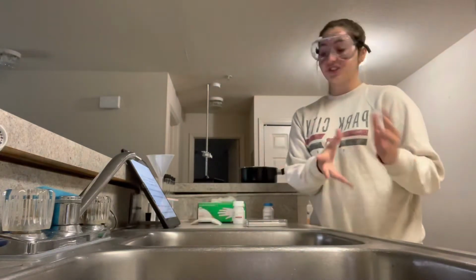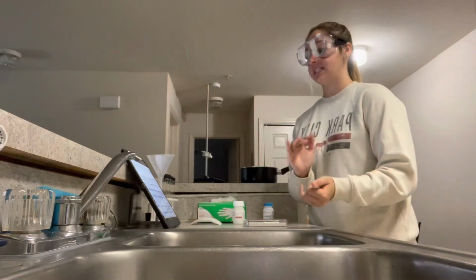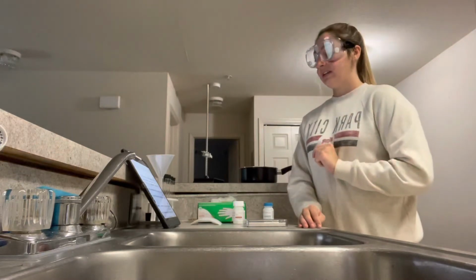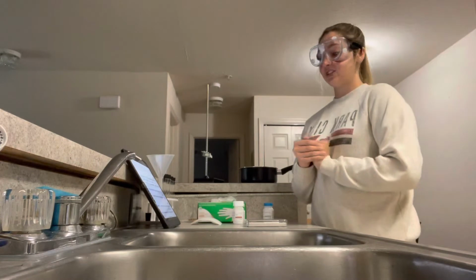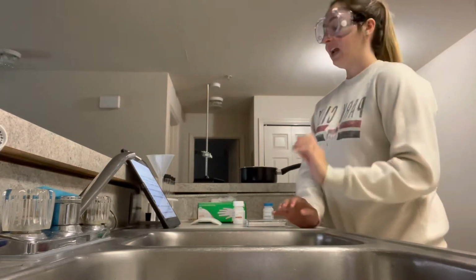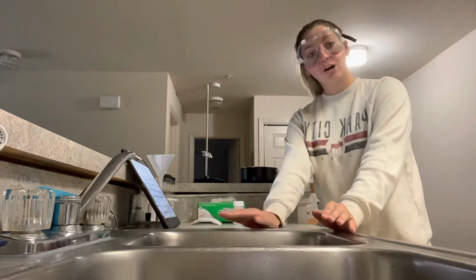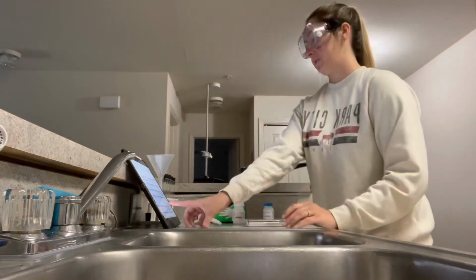And now for those hazards. Paradichlorobenzene will cause eye irritation and is suspected of causing cancer and is toxic to aquatic life. Naphthalene is harmful if swallowed and is suspected of causing cancer, toxic to aquatic life. And that is why we will not be dumping it down the sink, so it does not hurt our aquatic life or any living creature which it might reach.